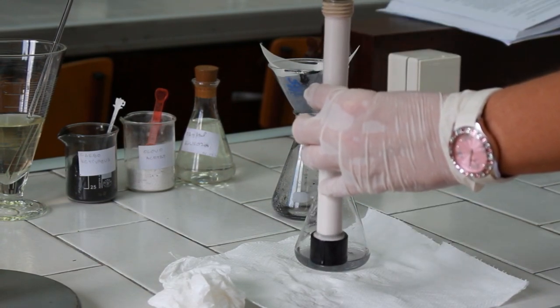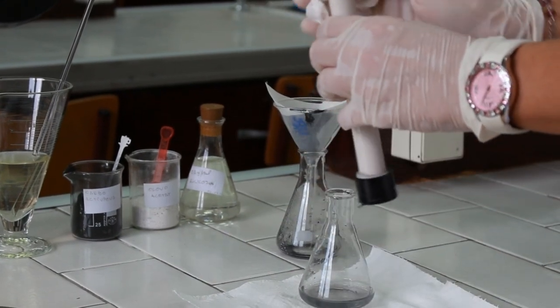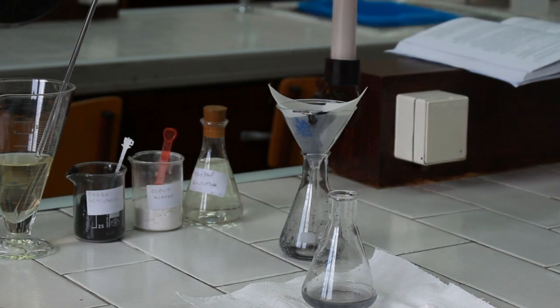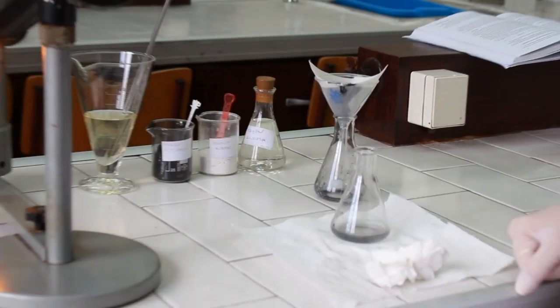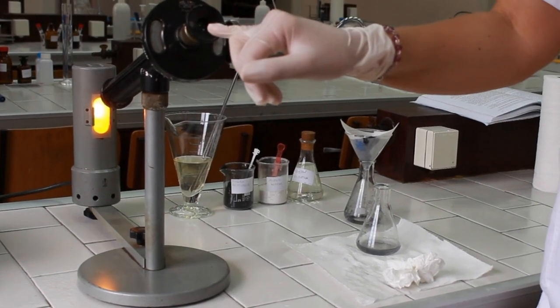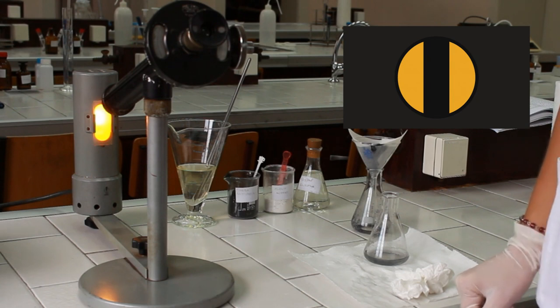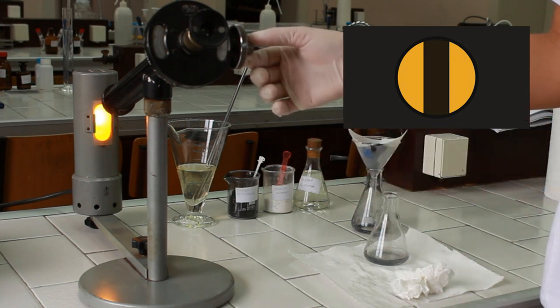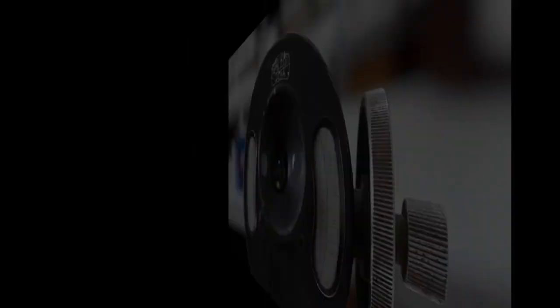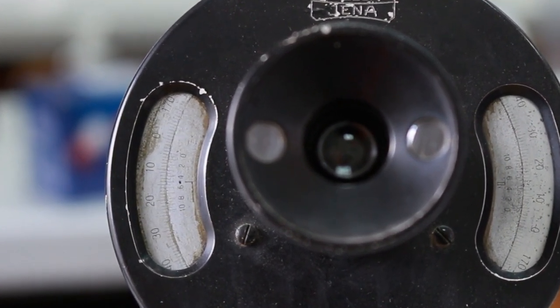Put the glass, avoiding making bubbles. Close the polarimetric tube. Wipe it and place it in the polarimeter. When the angle is zero degrees, you should see again the black line in the middle of the yellow circle, indicating that a certain amount of glucose is present in the urine. Rotate the analyzer very slowly until the black line fades out and again you see the homogenous yellow circle, then read the angle of rotation.